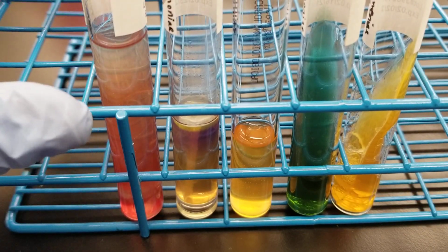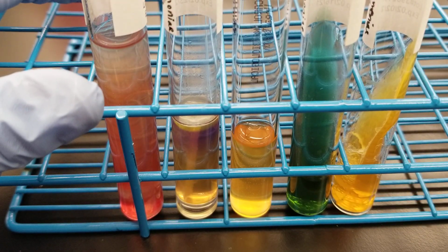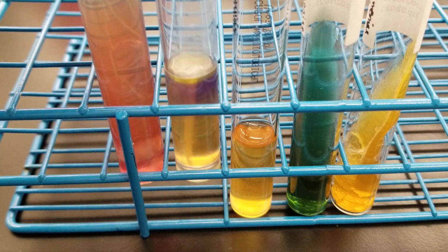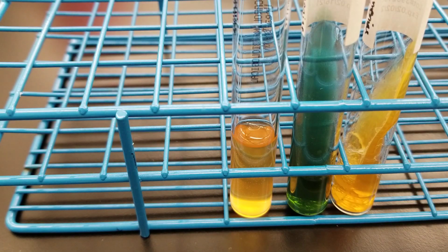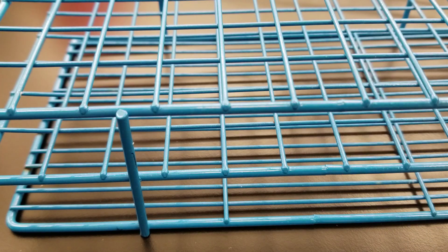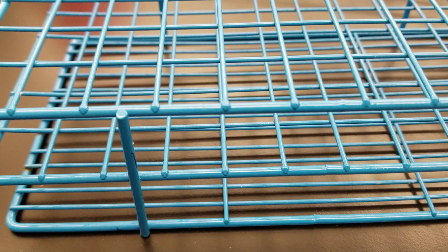So let me get the next one. Those were all our lactose fermenters, and remember that Serratia is a late lactose fermenter. So if you're growing it on MacConkey, you might want to put it back in for another night, and I'll pull it out, put it in the fridge so that you can see hopefully that transformation.